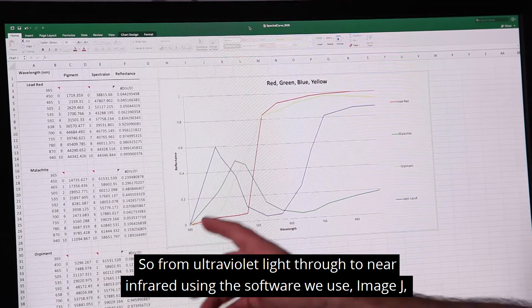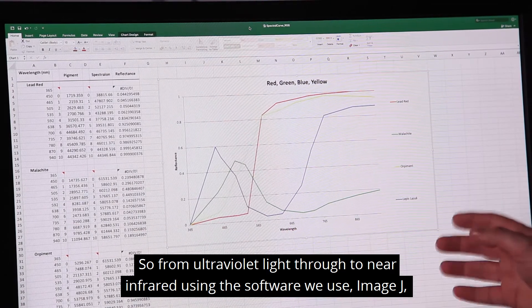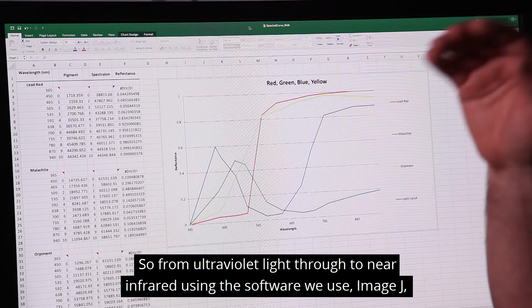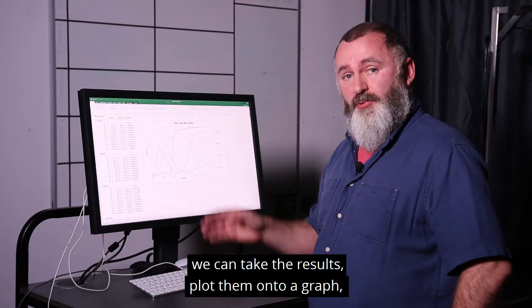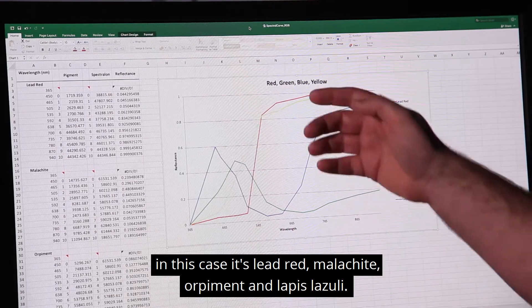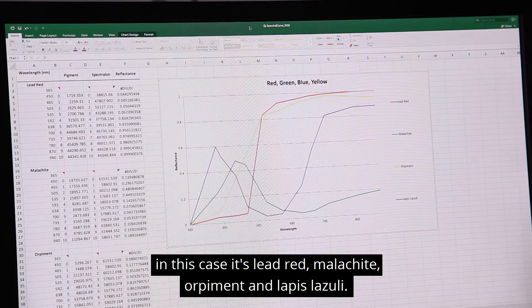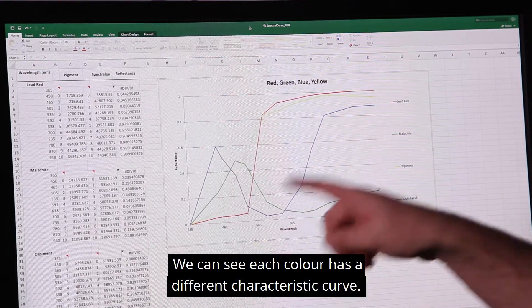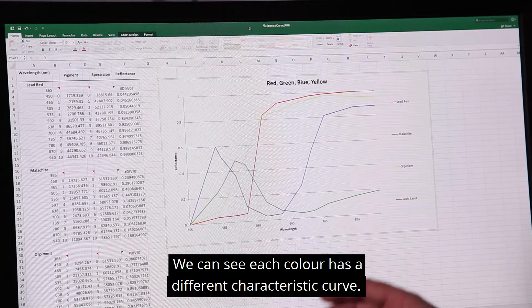From ultraviolet light through to near-infrared, we use the software ImageJ. We can take the results and plot them onto a graph. In this case it's lead red, malachite, orpiment, and lapis lazuli. You can see each colour has a different characteristic curve.